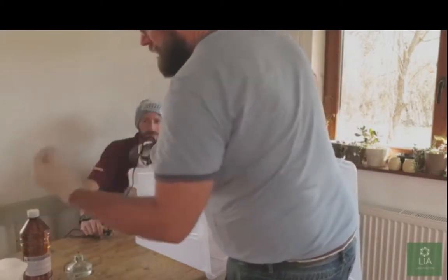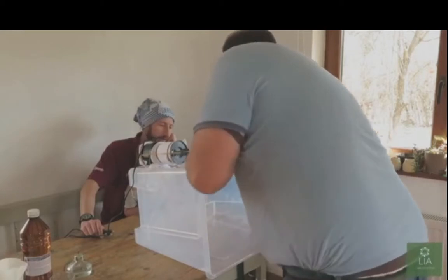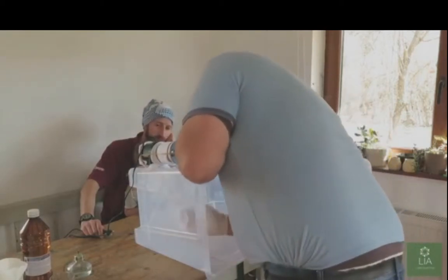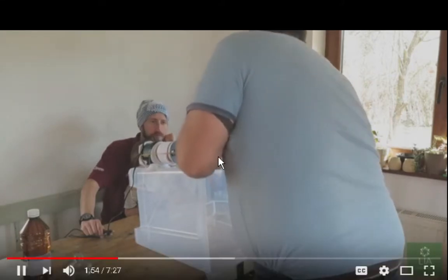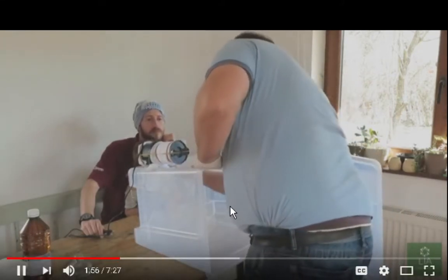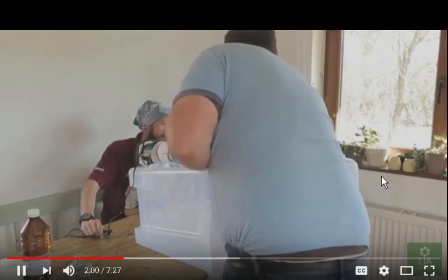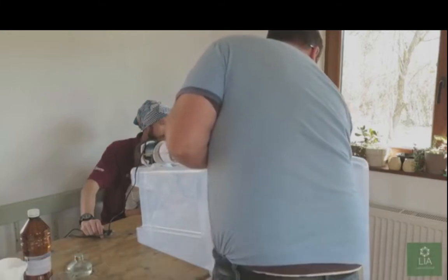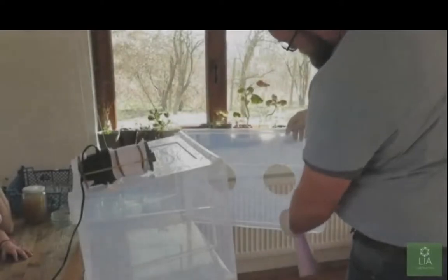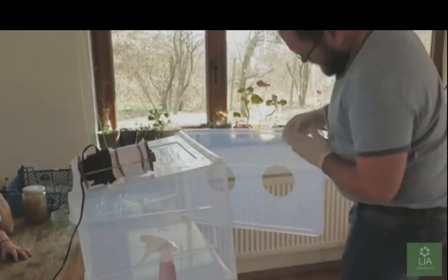More or less. My container is an aquarium. It's a glass aquarium. And I'm going to put plastic with gloves that go inside, and maybe somehow I've got to be able to transfer that stuff into the aquarium before I do the final sterilization. I sort of have a makeshift hood. It's not the best setup, but hey, what are you gonna do?